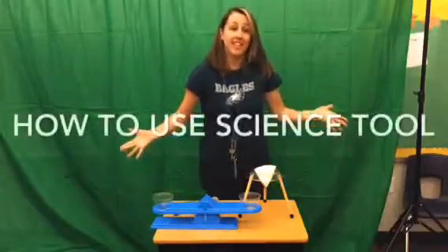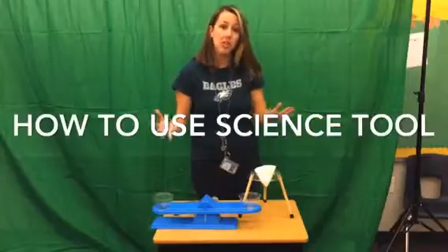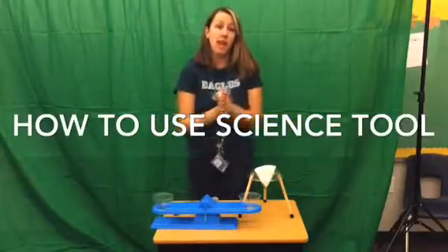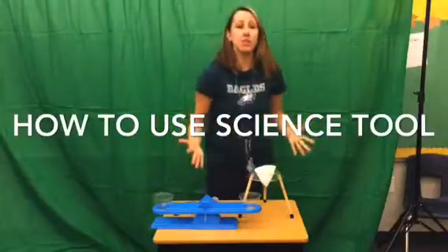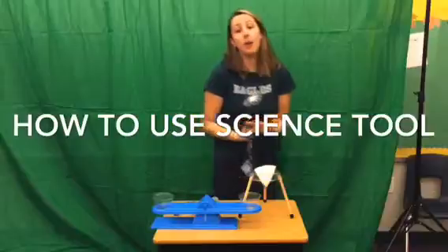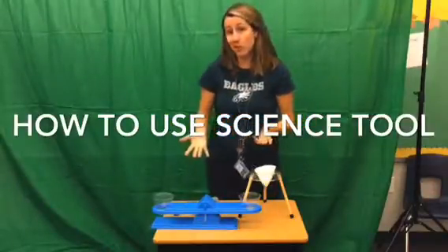Hey 5th grade scientists, it's Mrs. Worrell here. We have a lot of new tools that we're going to use in our next science unit for FOSS. It's called Mixtures and Solutions, and as you can see here, there's lots of materials that we need to learn and know about. So I'm going to go over some of them and show you how to use them so that we become familiar and so that we don't have to review those things during class.